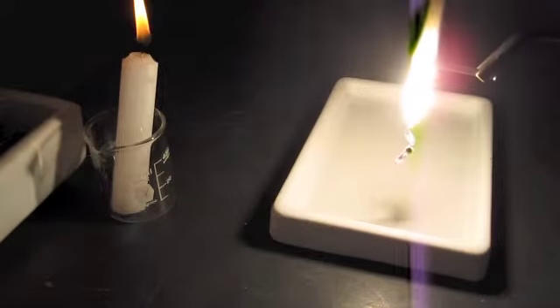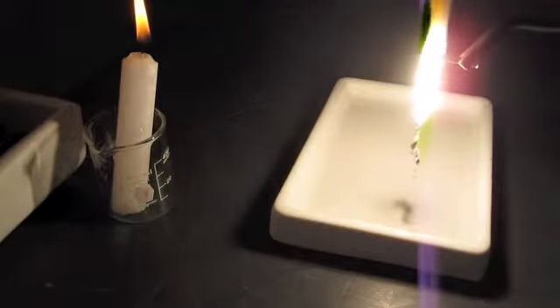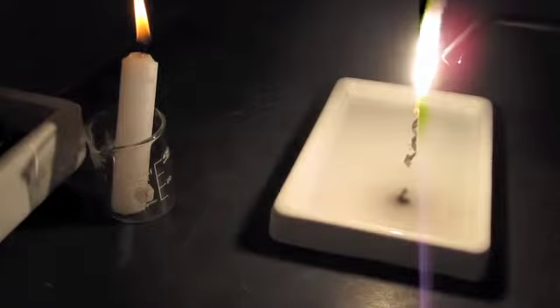So we have our magnesium reacting to the oxygen in the air, triggered by the flame.